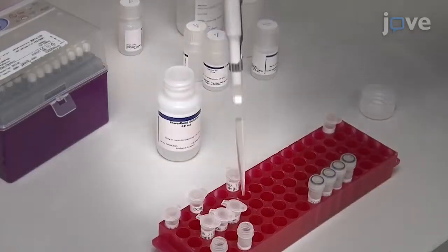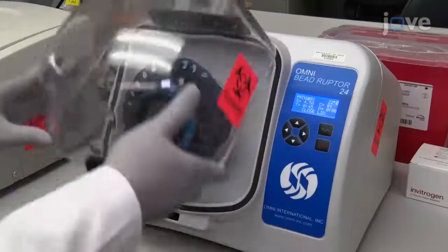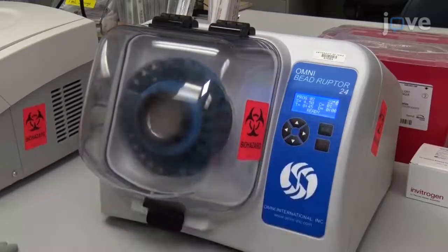Bead beating is the most important step, as all downstream steps depend on high-quality DNA. Proper sealing of the PCR plate is also important, as incomplete sealing might lead to evaporation of the amplified product, resulting in low-quality sequencing data.